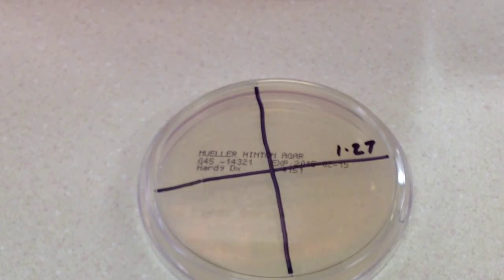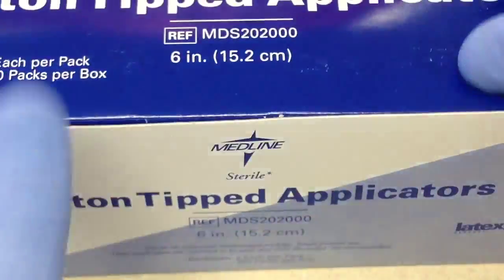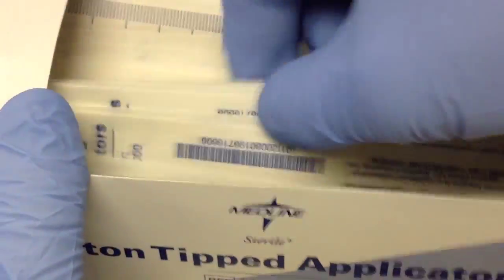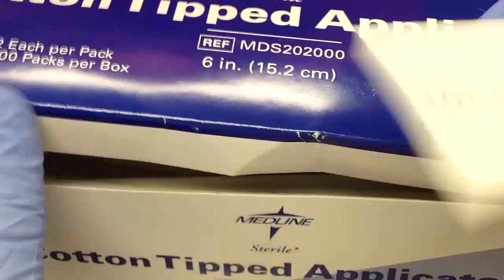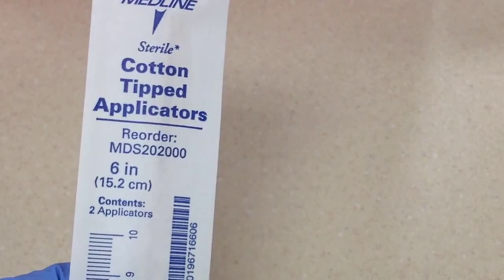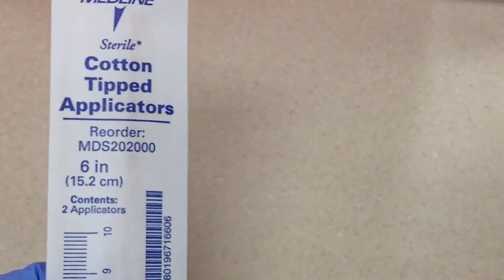So what I am going to do is I'm going to use a sterile cotton tipped applicator. And just make sure when you're doing this that in fact it is sterile, right? It says up here at the top, sterile cotton tipped applicator.